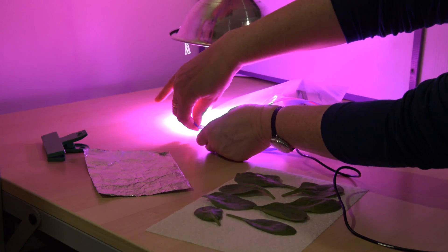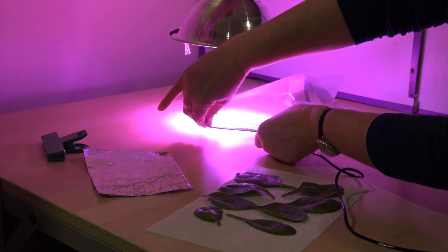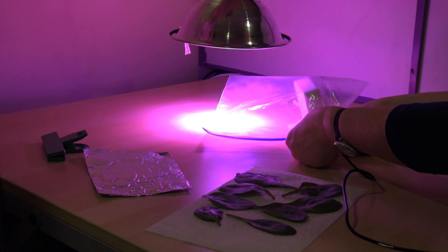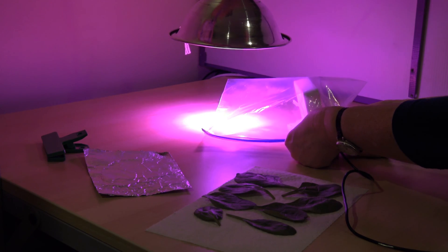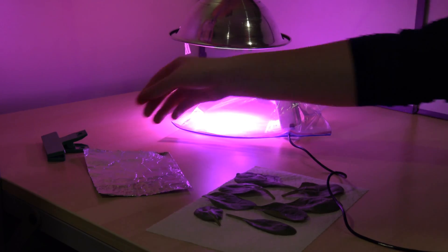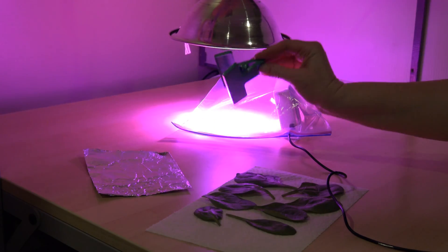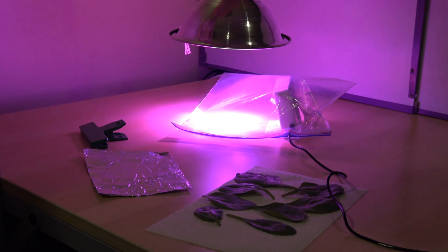Once our detector is inside we want to seal up the bag. Right now I'm just using the zipper on the bag to seal it, but you could also use chip clips or binder clips or clothes pins. Any of that would work.